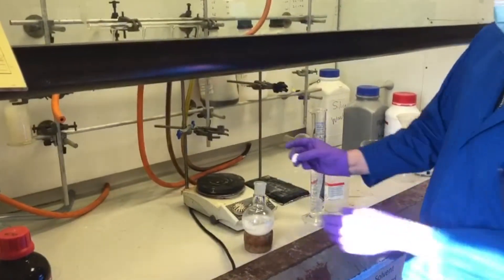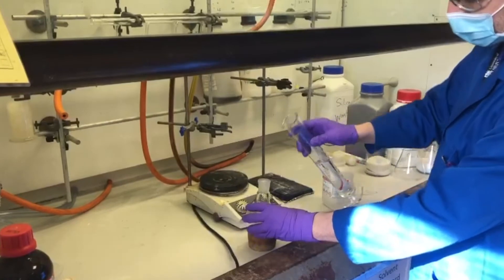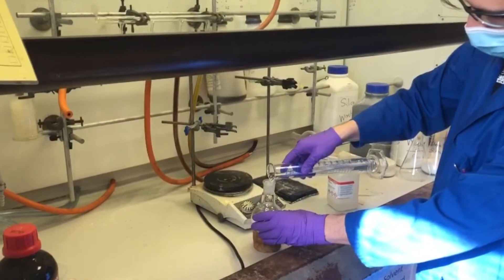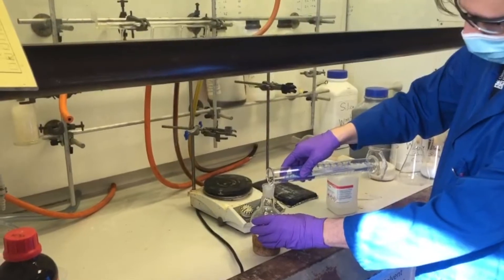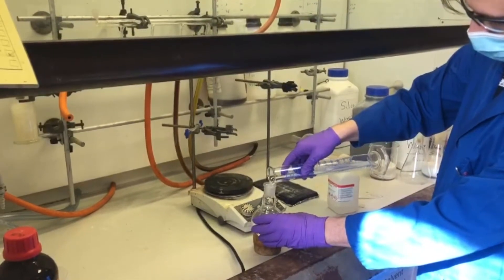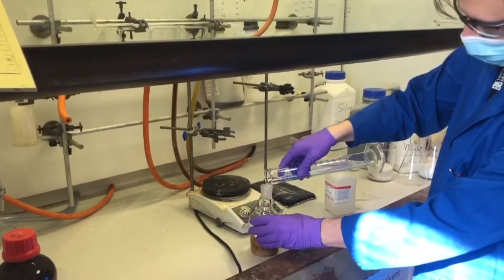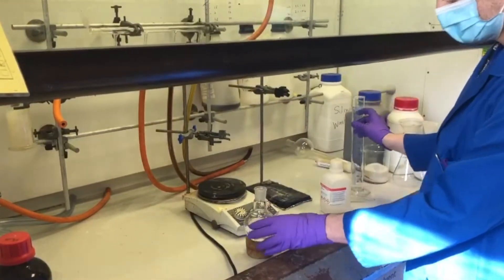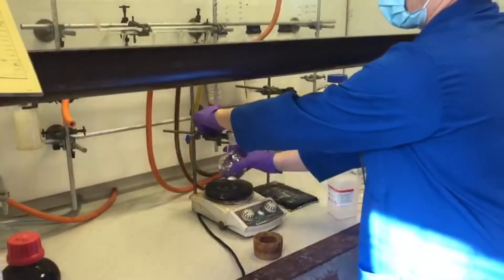Remember to add your stir bar. And we'll now clamp this up and leave it stirring for an hour.